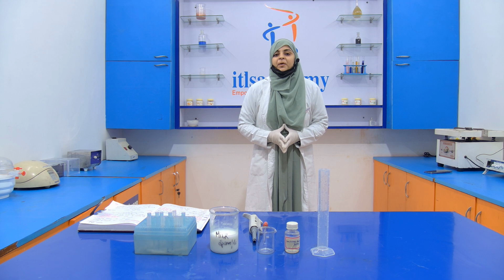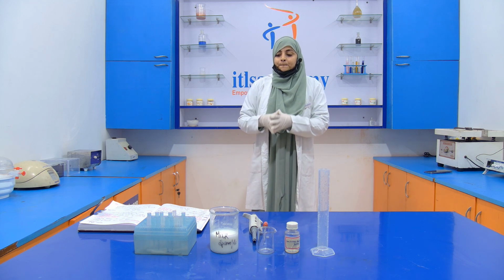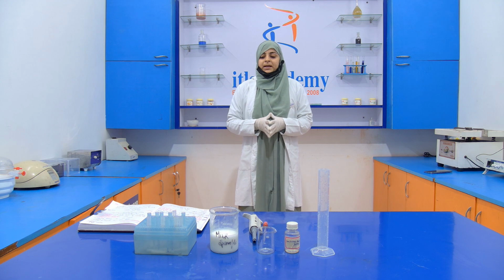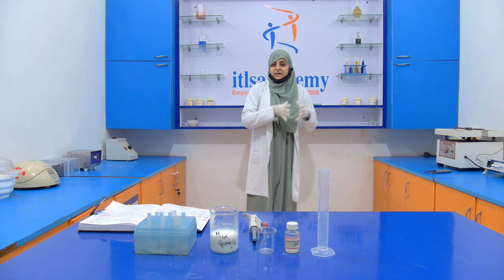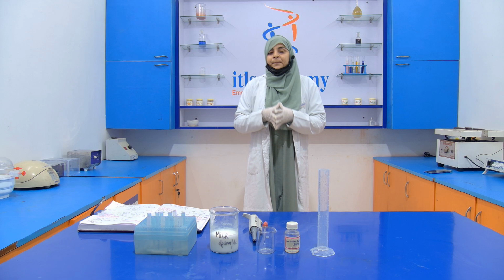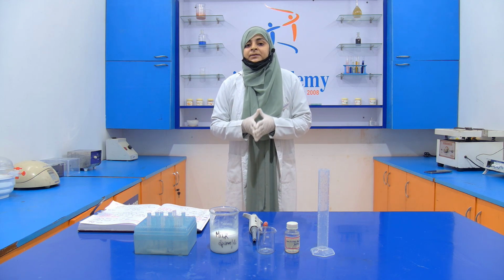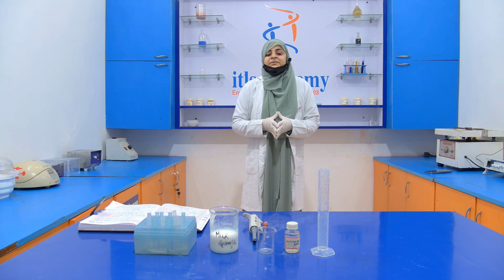Today we are going to perform an experiment in which we are going to see that skim milk is added into a milk, or you can say that we are going to detect skim milk powder in natural milk. Okay, so this skim milk powder here acts as an adulterant. Why? Because it is added into natural milk to adjust its fat content and SNF value, which means that it decreases its fat value.